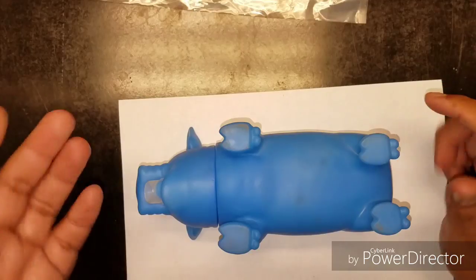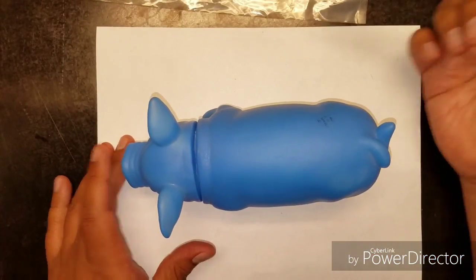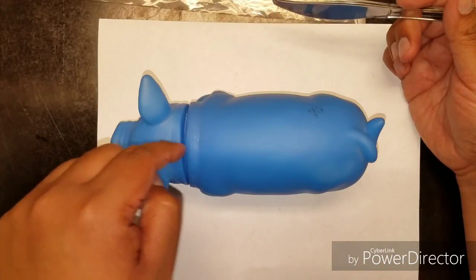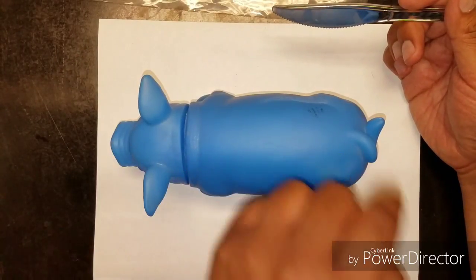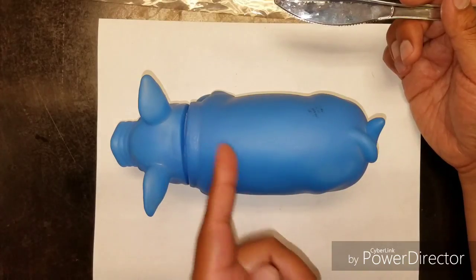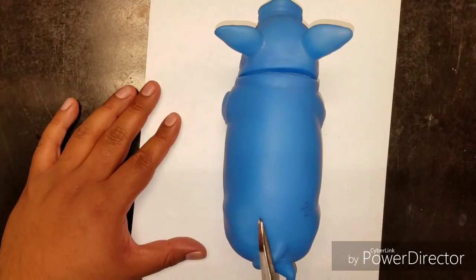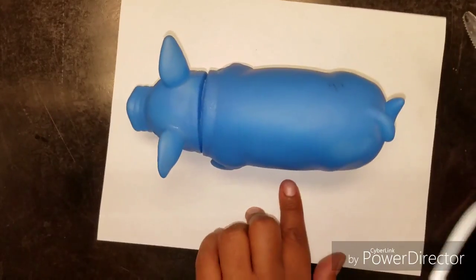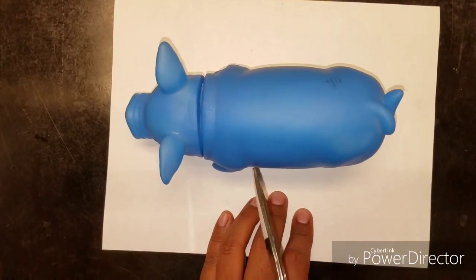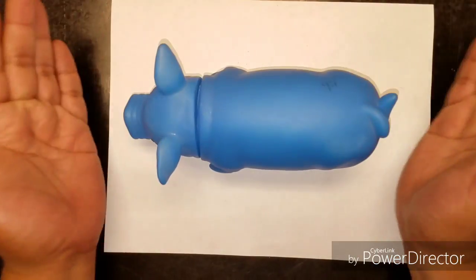All right, along with this, during your dissection, I'm going to be giving you a couple of instructions. They sound like technical terms, but they're really not that bad. One of the other terms you're going to need to know is longitudinal. Longitudinal just means long, so it's going to be a long cut, or transverse, which is just side to side, left to right. So it just kind of depends. Longitudinal would be a long cut this way, transverse this way. Same thing, long, transverse, side to side. All right, so you're going to combine it with the other terms.